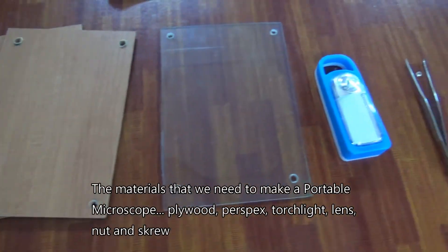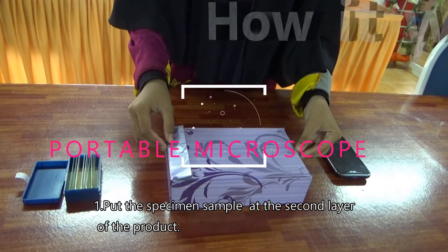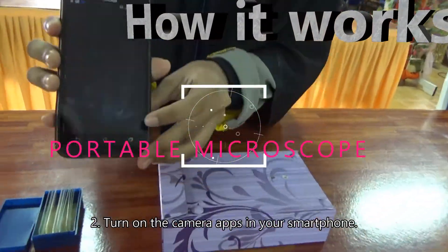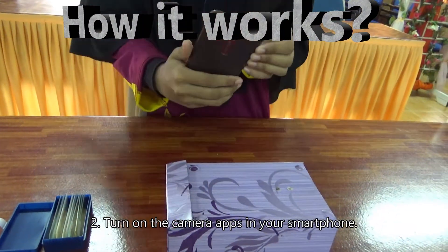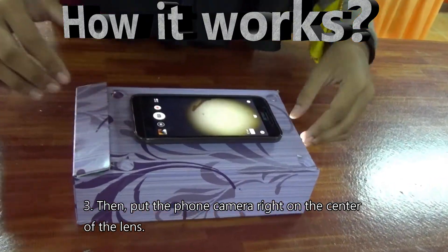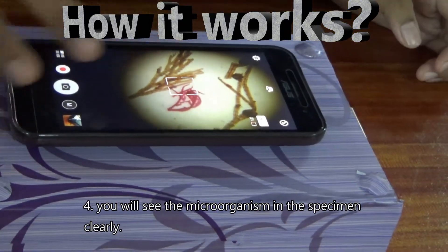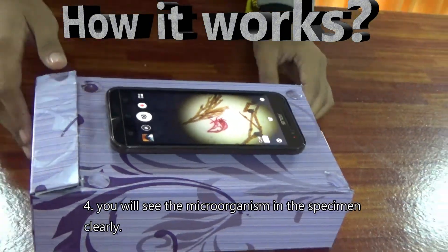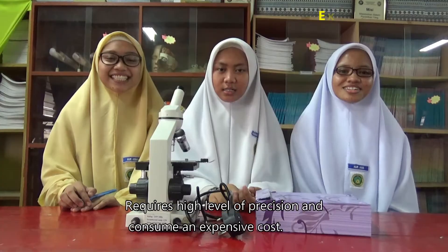Let's find out. Materials and tools. First, put the specimen sample at the second layer of the product. Second, turn on the camera app in your smartphone. Then, put the phone camera right on the center of the lens. You will then see the microorganism in the specimen clearly.